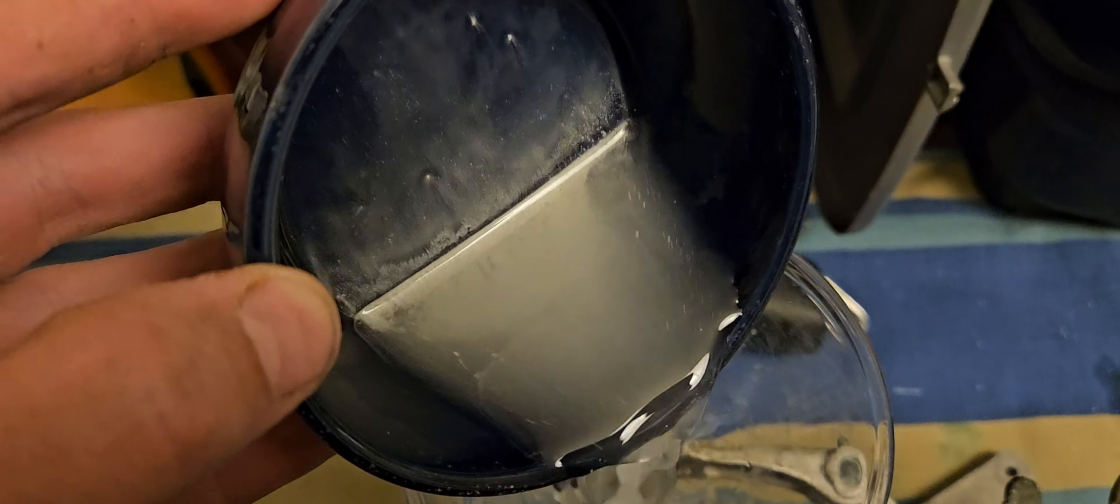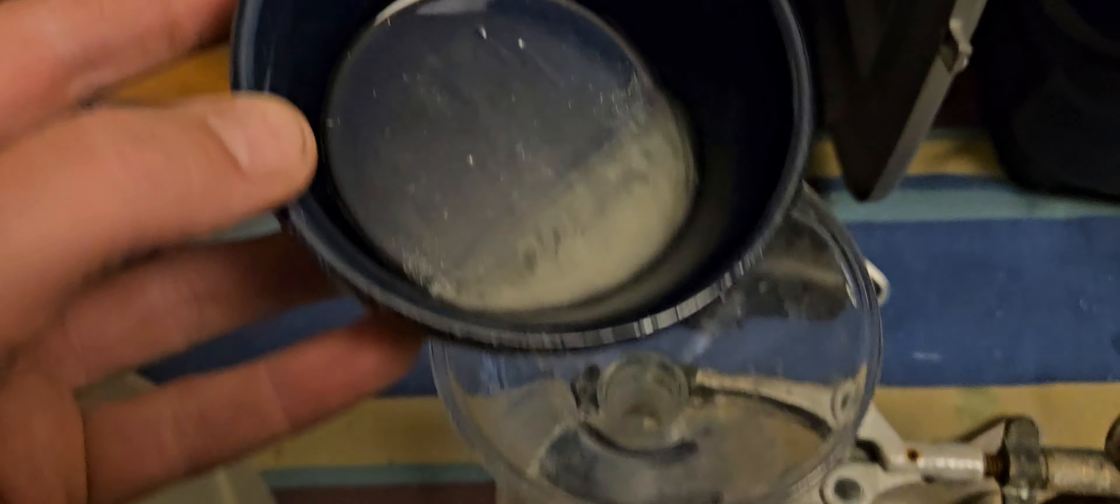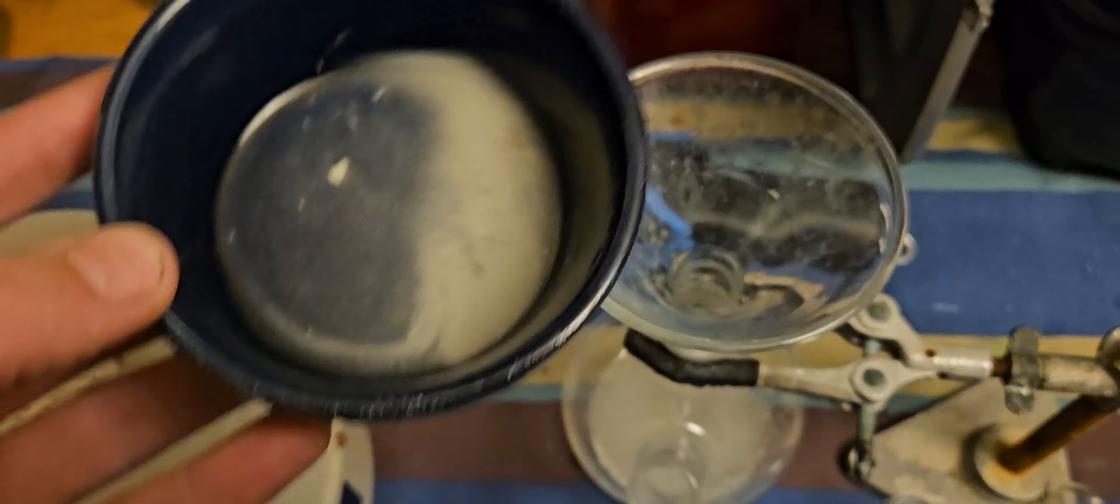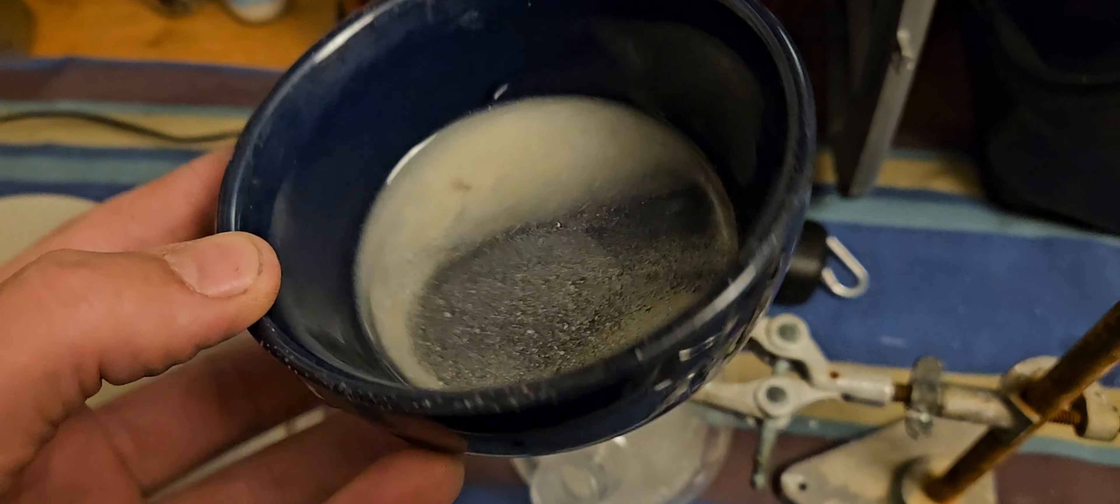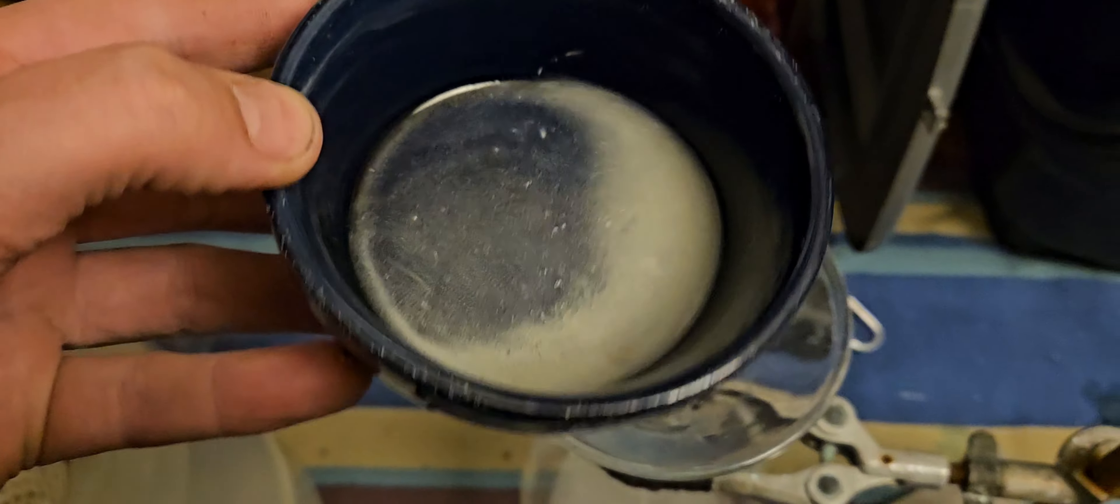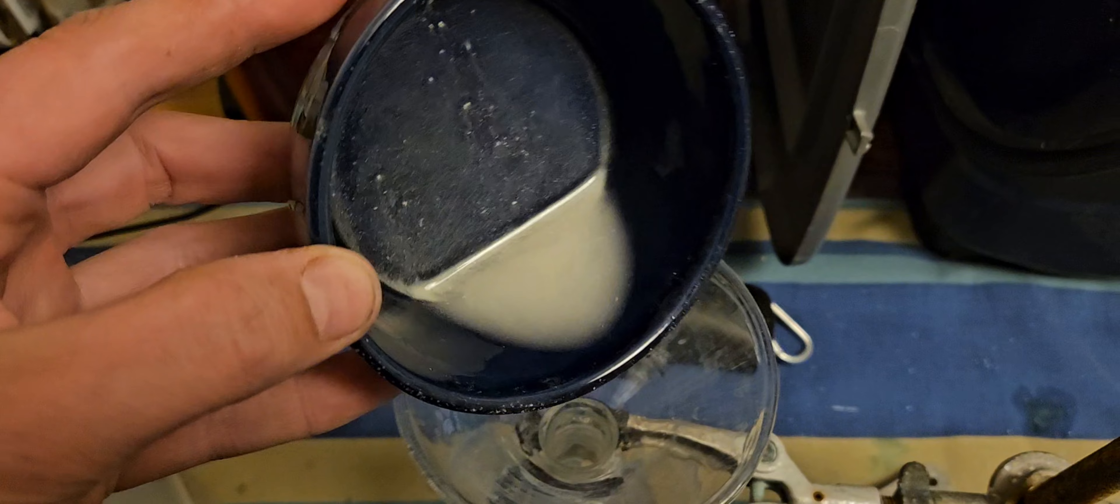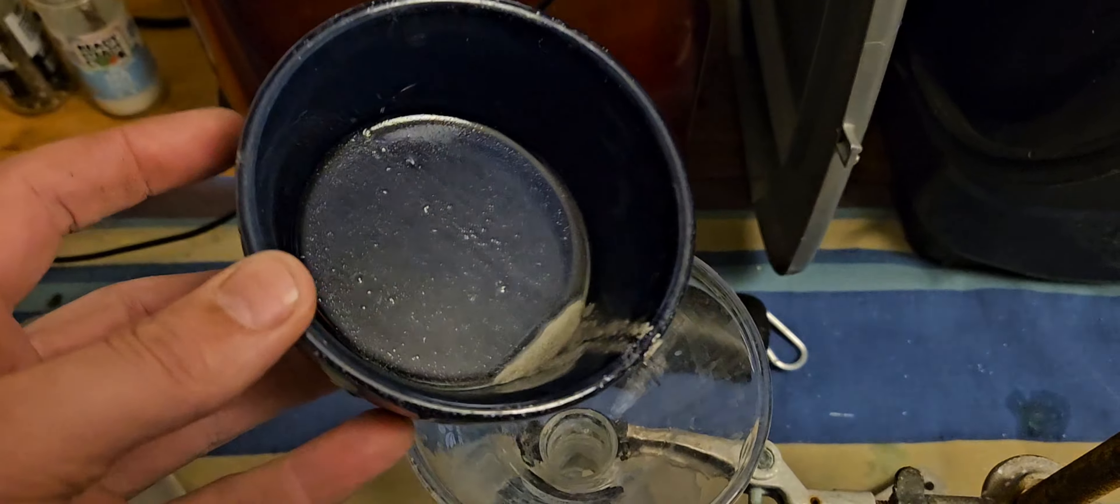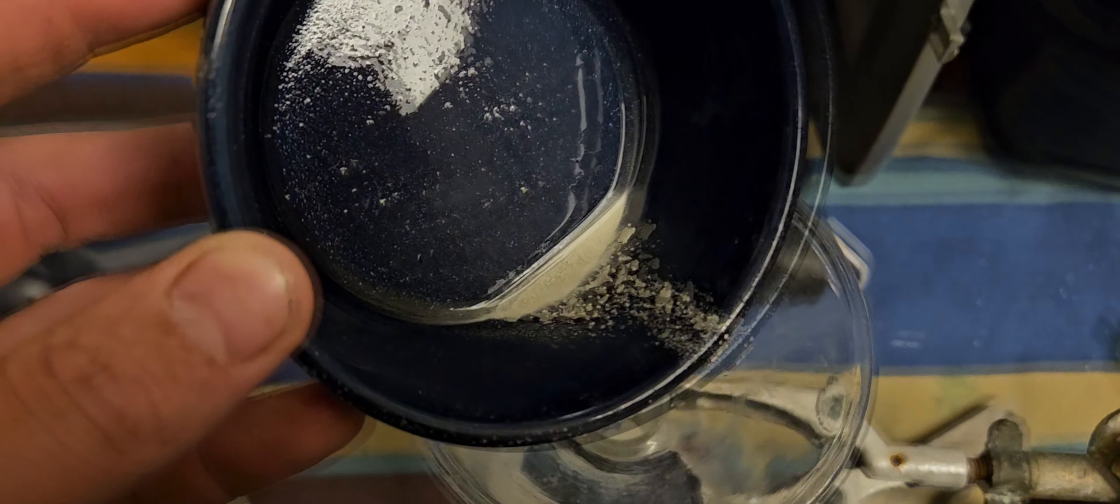You can see it there. Tiny bits of paper but we can separate that later. I should be wearing gloves.